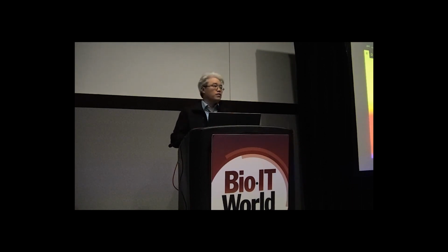This lands you on the Omics console. For this part, we're going to focus on storage. If you pop open the nav, which is collapsed for me because I've got it on half of my screen, we're going to go under Storage and then to Reference store. A reference store is where you put reference genomes. These are normally raw FASTA files, the source code of whatever organism you're looking at: people, mice, rats, fish.